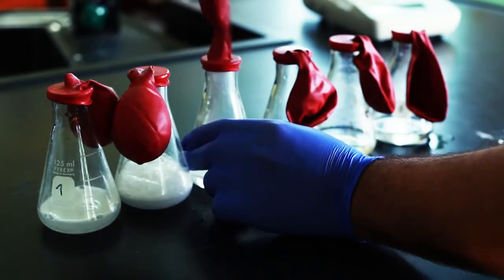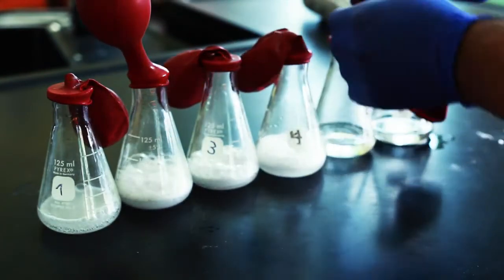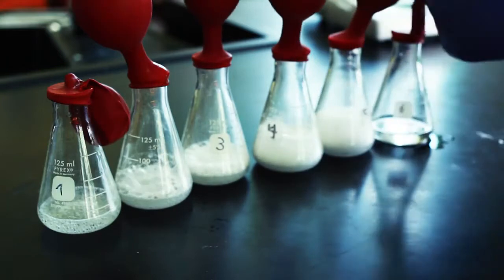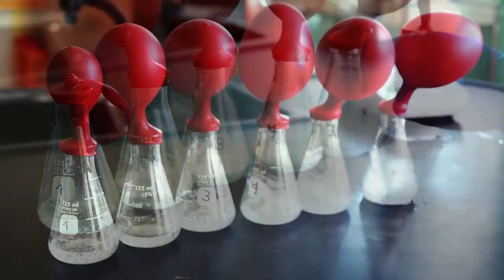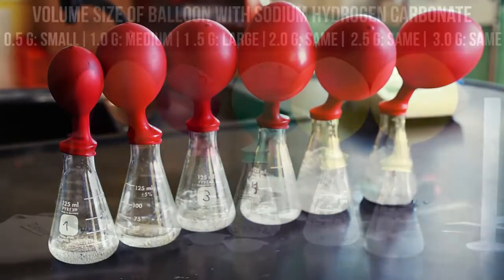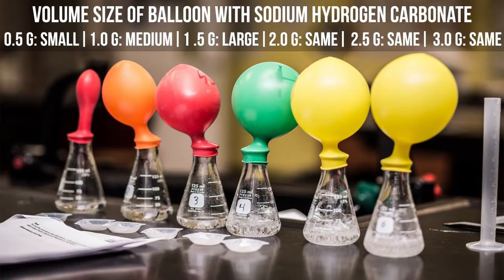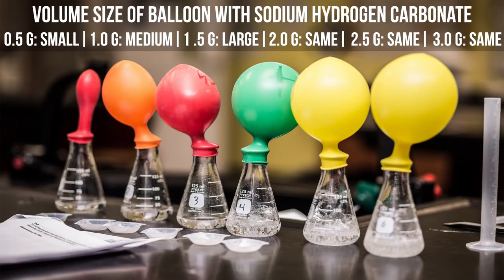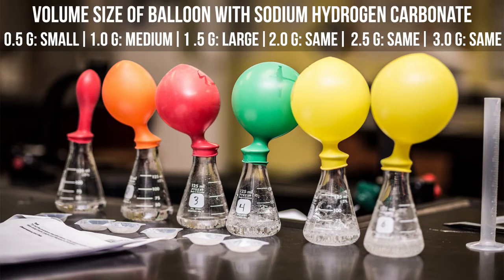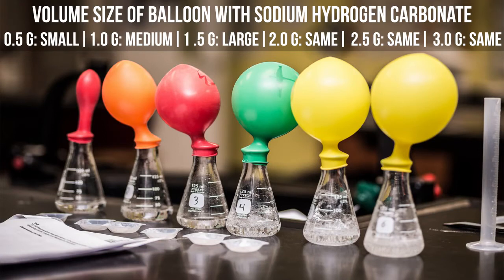As a result of the reaction, each balloon inflated and its volume increased from the carbon dioxide gas generated. The balloons increased in volume until the fourth balloon. Even though the amount of sodium hydrogen carbonate was increasing, there wasn't enough acetic acid to dissolve the larger amounts of the substance. Therefore, the acetic acid becomes the limiting reactant.